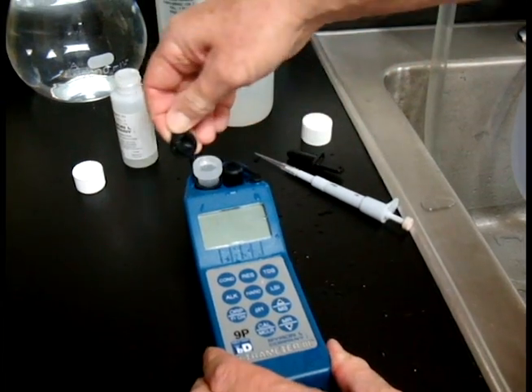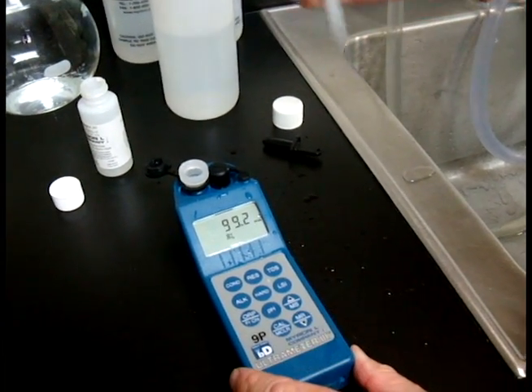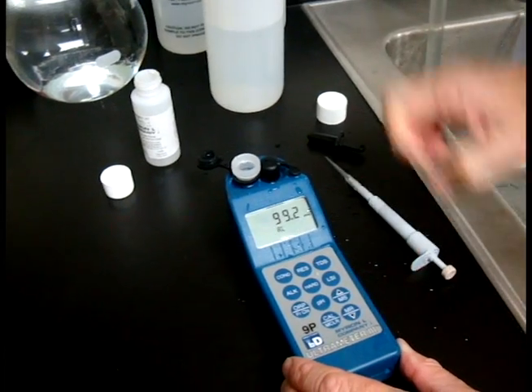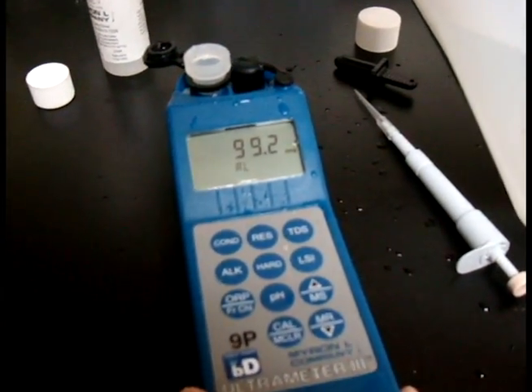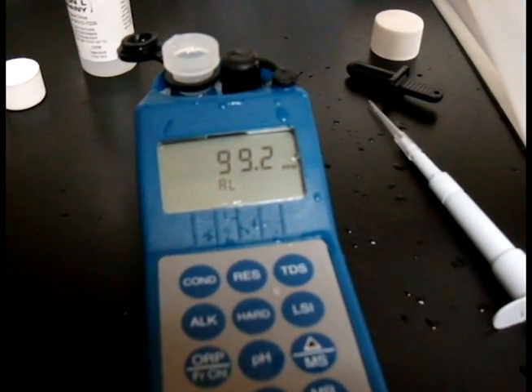Open that up. Get CAL. And there's our number. As you can see, we start out with 100 ppm, and this is what we got after titrating. Very good number.